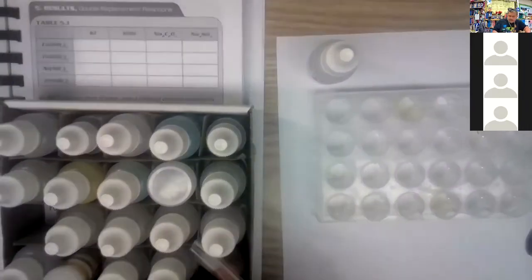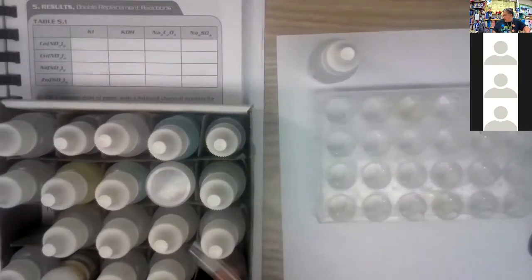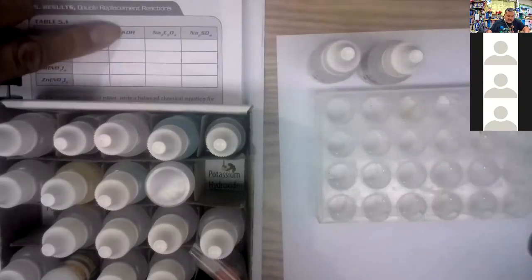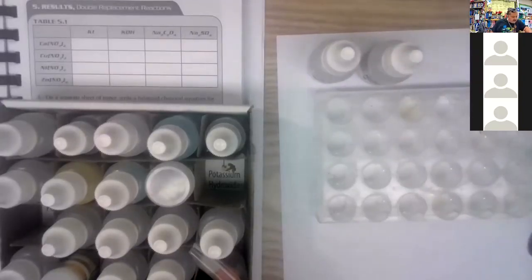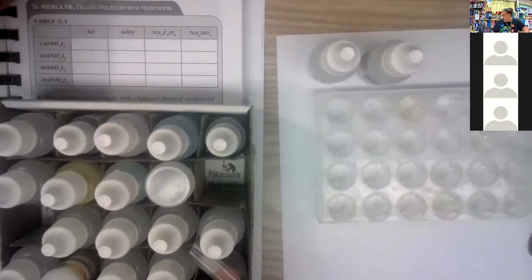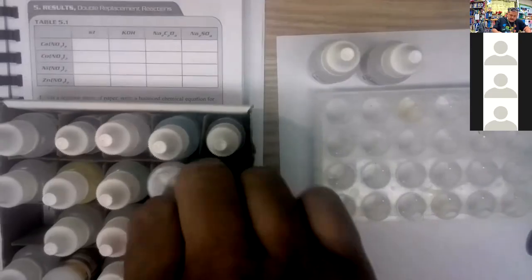Okay, and then we've got sodium hydroxide. Let's see, where's that in your box? Oh, it's not sodium hydroxide, it's potassium hydroxide, which is right here. Here's potassium hydroxide. Obviously K, potassium. Okay. There's the sodium oxalate, which is this one right here. So I'm looking at your box. Sodium oxalate is third row, fourth column. Let me see, there it is. Sodium oxalate.